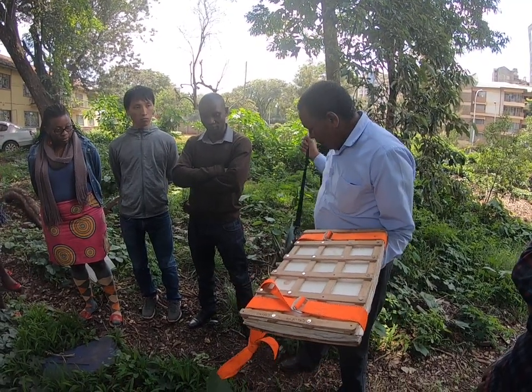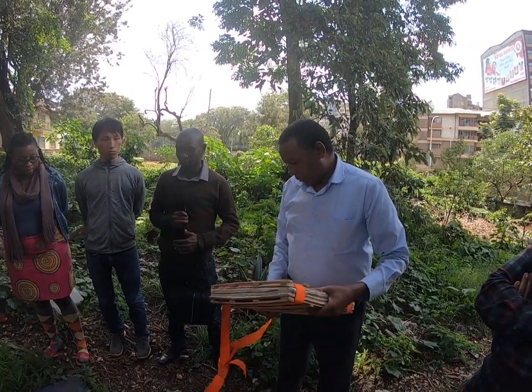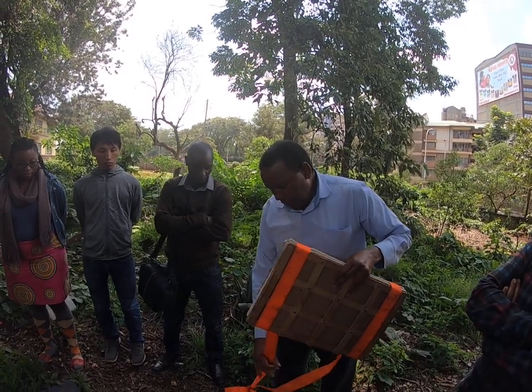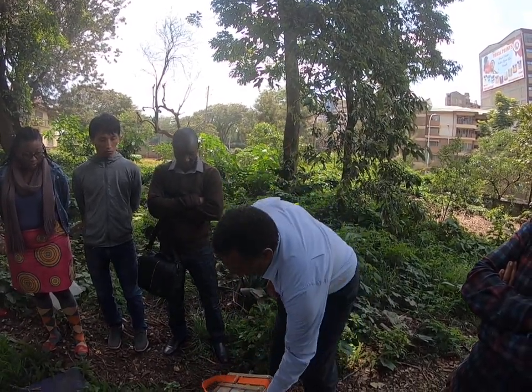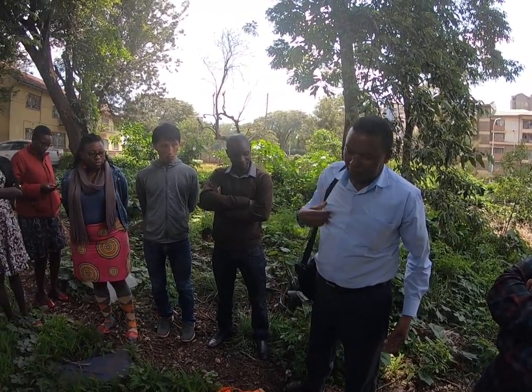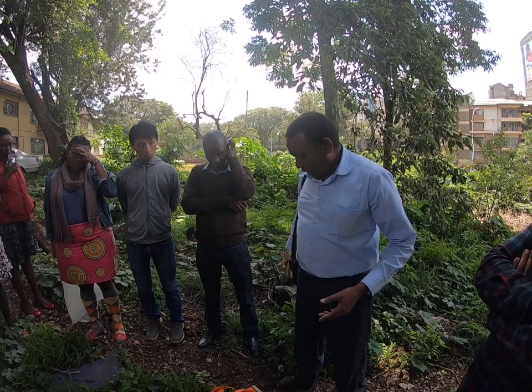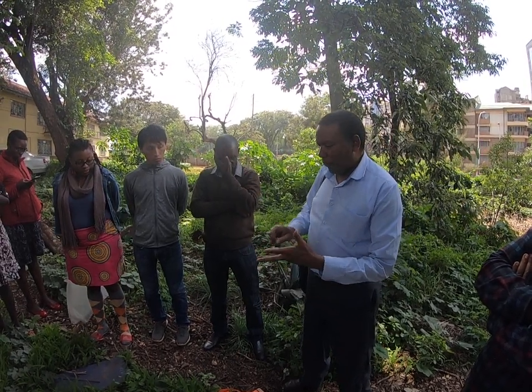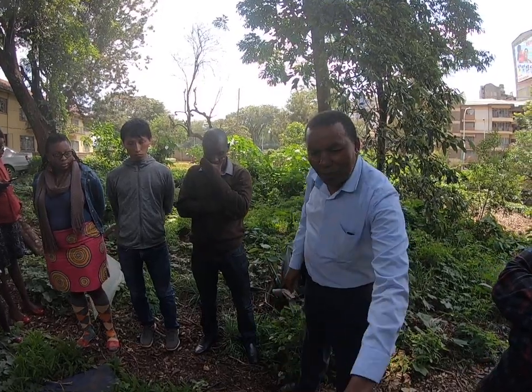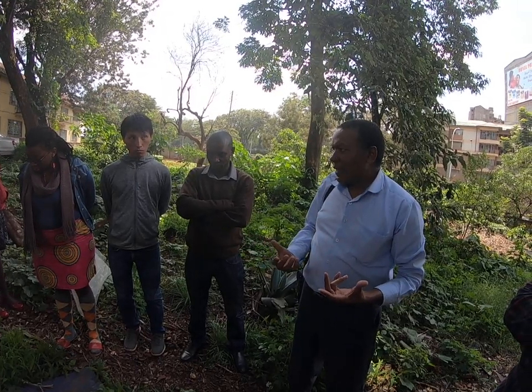So what I'm going to show you now is how to collect a plant specimen. But before then, whenever I'm going to the field, I always bring a camera with me, because you may not be able to collect everything, but the camera can help you take photos of the fruit, of the habit. Habit is the way the plant is crawling or is growing. That is the habit.